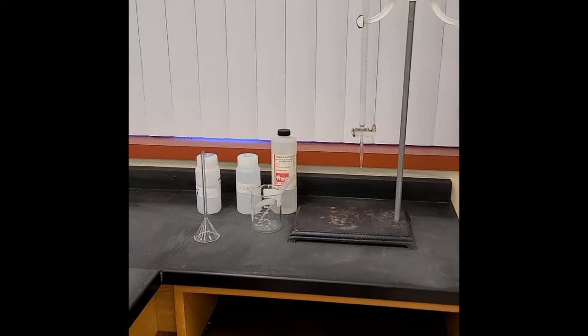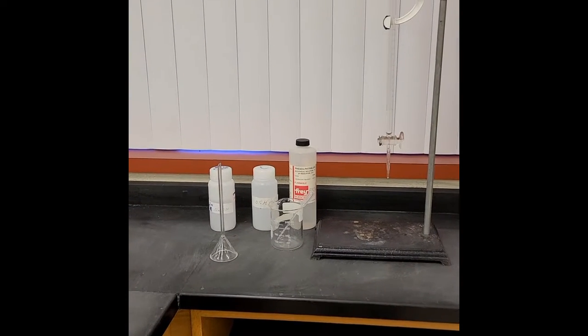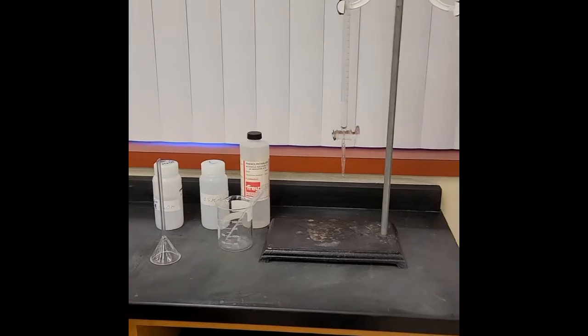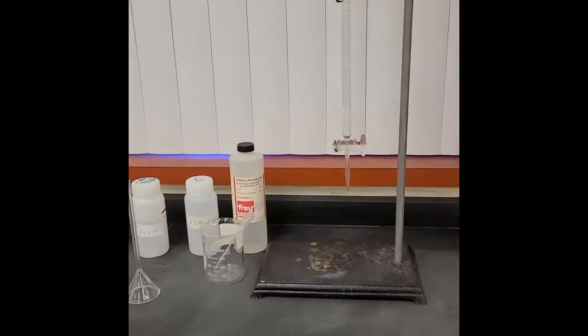Today I'm going to show you guys an example of what we would use the molarity equation for, and how we can combine that with a little bit of stoichiometry in order to do a little bit of application of chemistry here. I've got my gloves on, got my goggles on, but I'm not doing a face reveal for any of these videos.